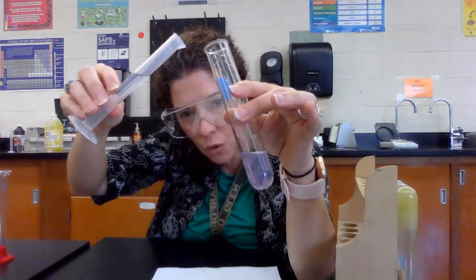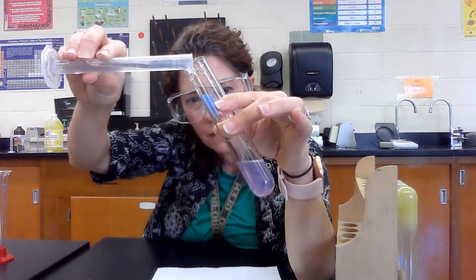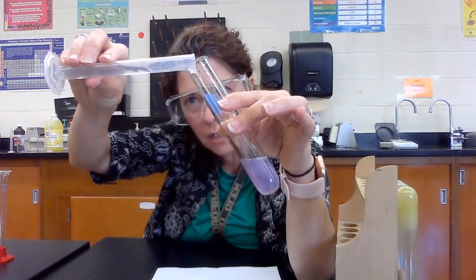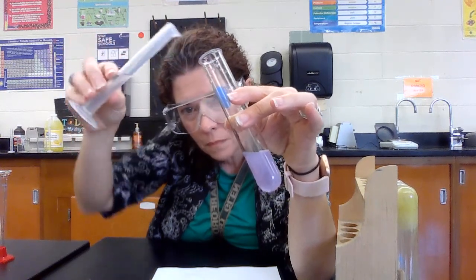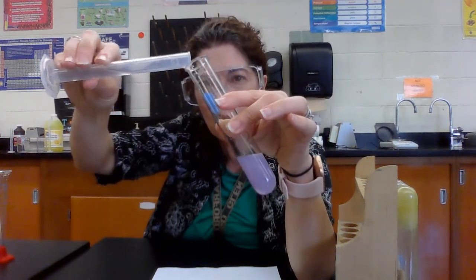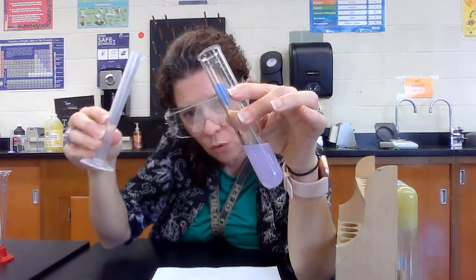You can see that little swirl — that is a precipitate that's forming. As I add more you can see it. So what we're getting in here is it's turning a little bit of a purplish color and you're getting a precipitate forming.